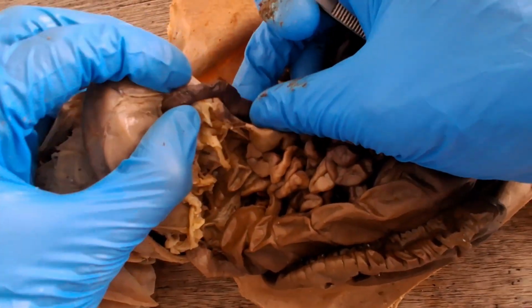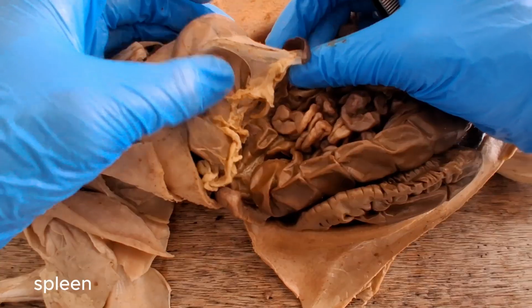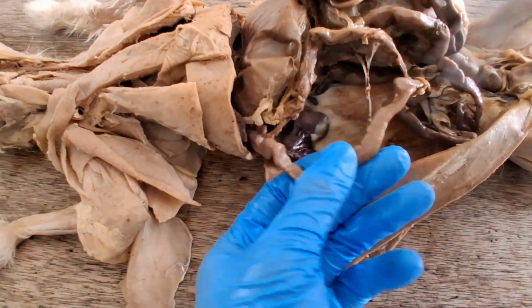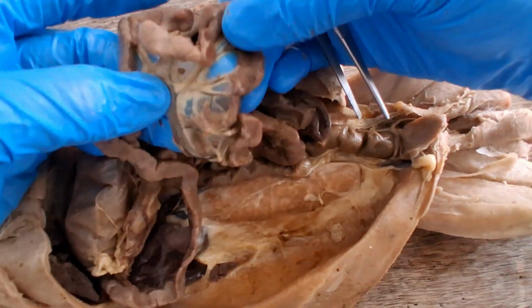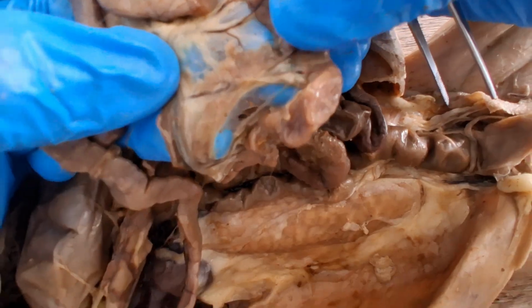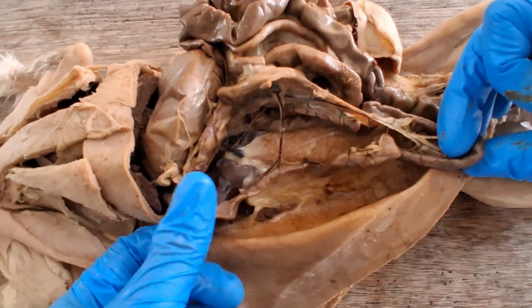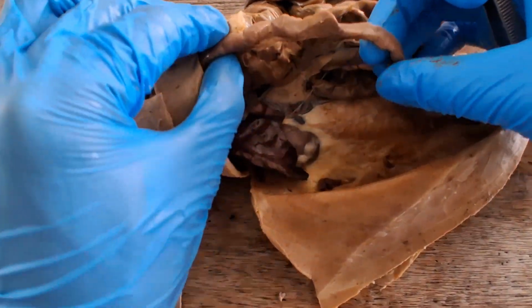There's a black organ here beside the stomach, that's the spleen. It breaks down old red blood cells. And then there's supposed to be a mesentery here in the duodenum, in which you will find the pancreatic tissues. So this is a remnant. Those brown stuff there is the pancreas. It's beside the duodenum. One of its functions is to secrete many digestive enzymes into the duodenum so that the food can be completely digested.